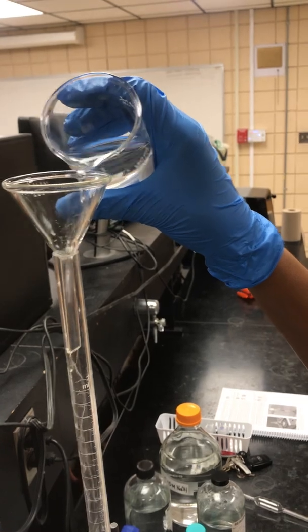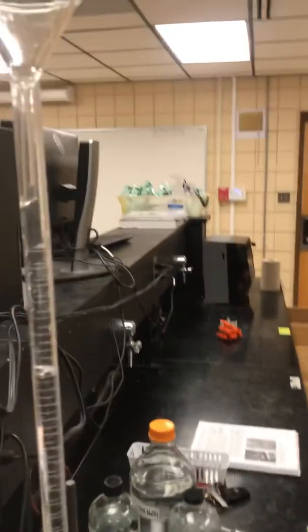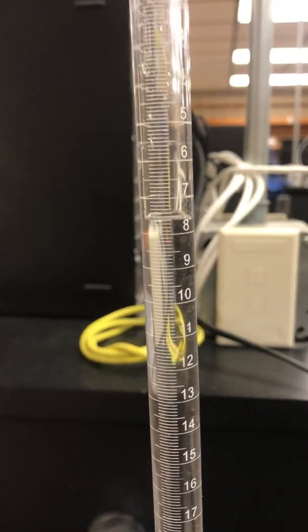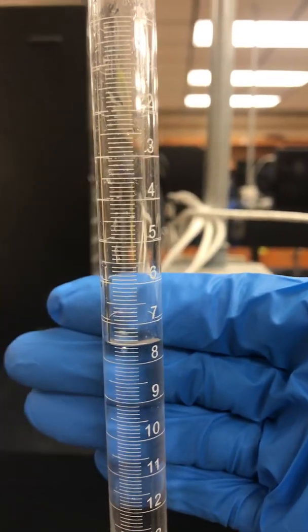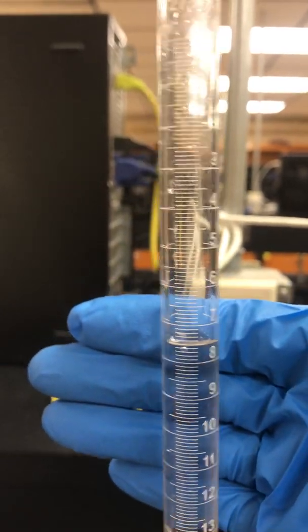You do not have to fill it all the way to zero. You notice I stopped somewhere. You would read it by looking at the meniscus, the same way we did for the graduated cylinder when you did the molarity calculations.